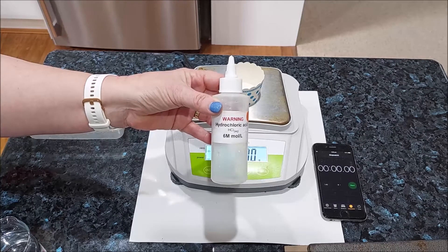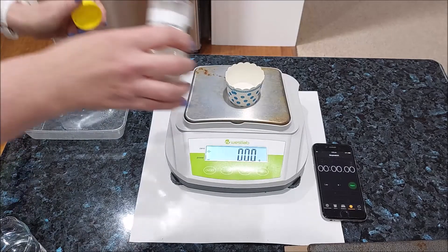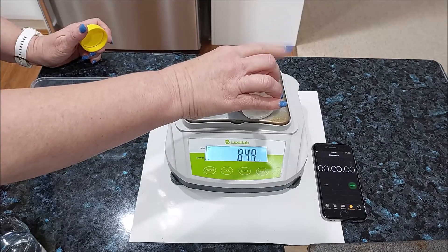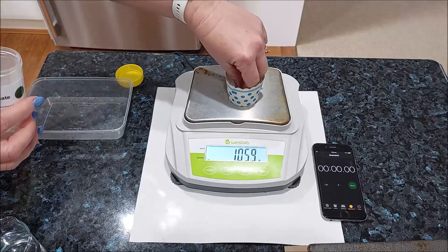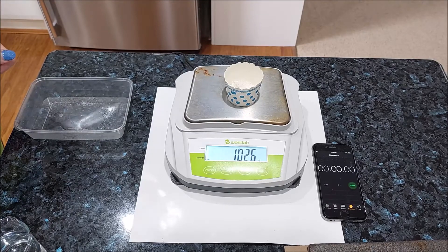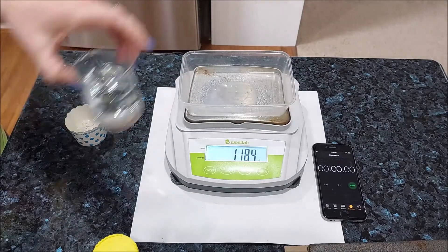And last one — 6 mol per litre acid. Let's weigh our 10 grams of marble chips. That'll do. So remember we're adding 10.26 grams to our starting mass.